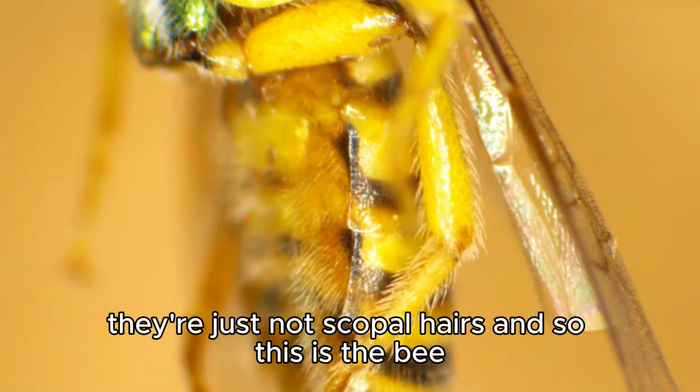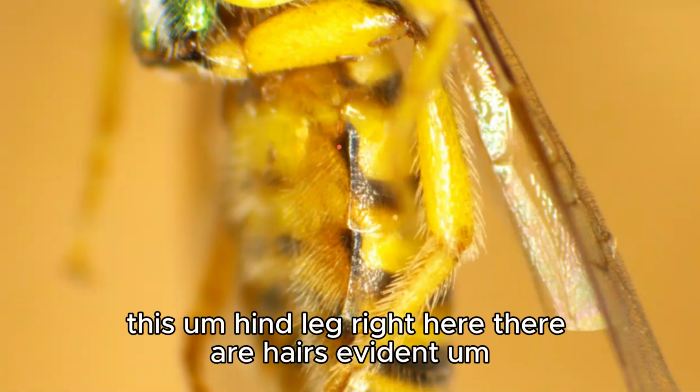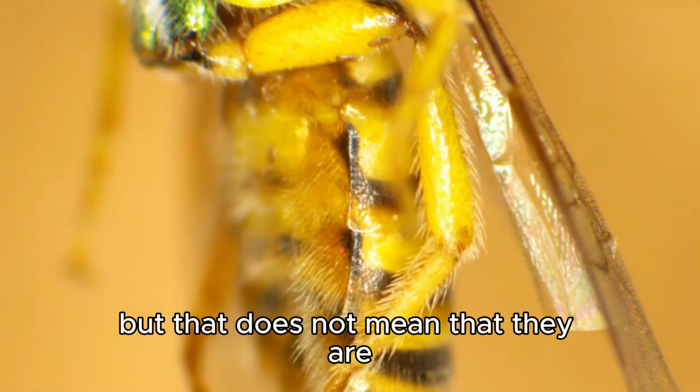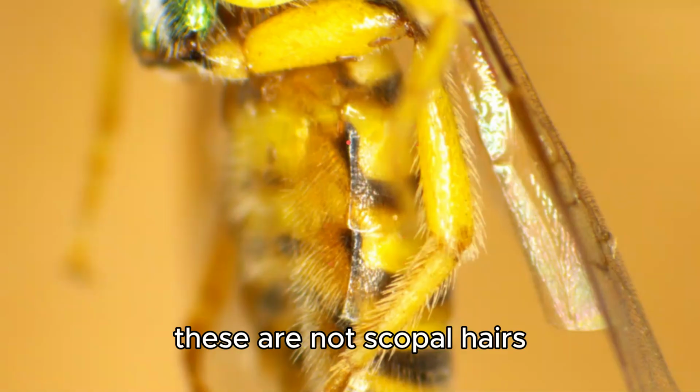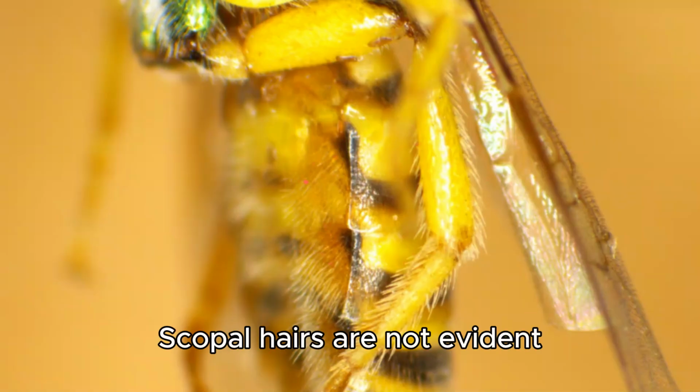And so this is the bee that we are identifying and that we've been using. You can see this hind leg right here. There are hairs evident. You can see also on the abdomen there are hairs, but that does not mean that they are scopal hairs. These are not scopal hairs. We will now go to the couplet that says scopal hairs are not evident.